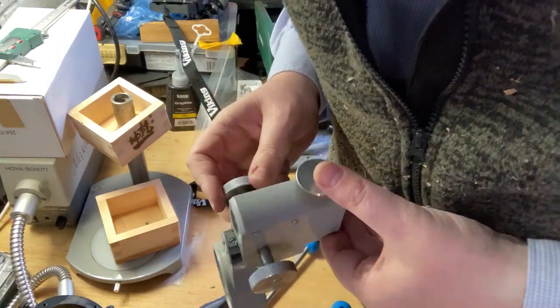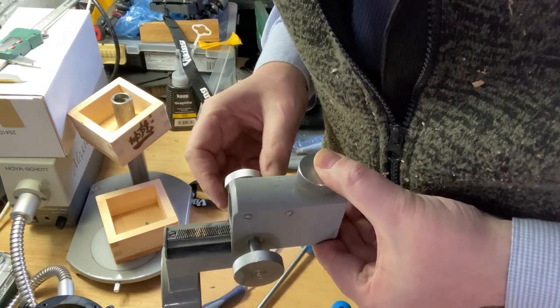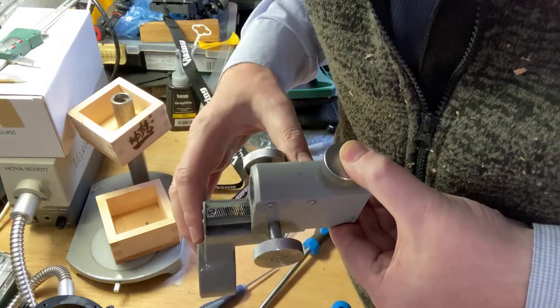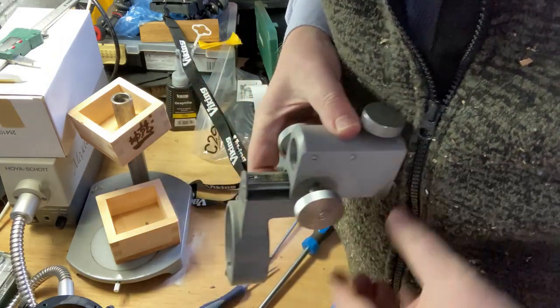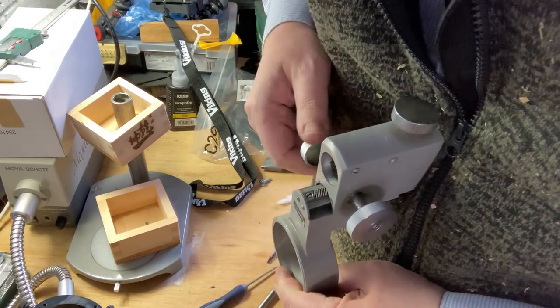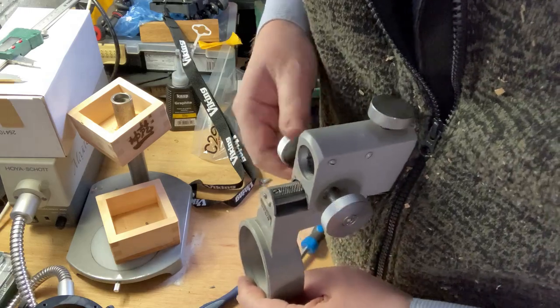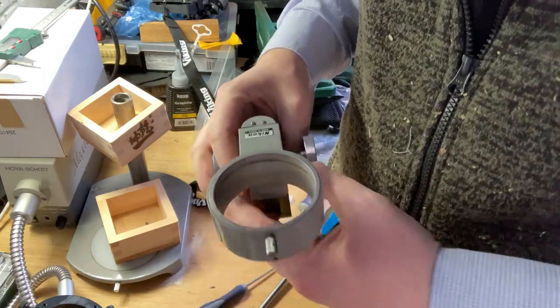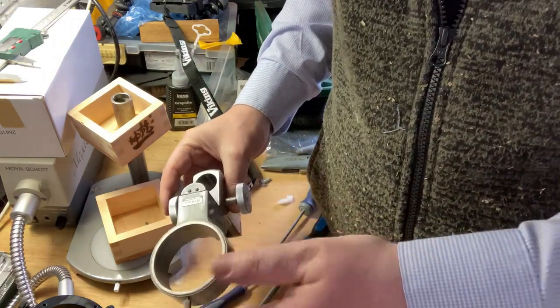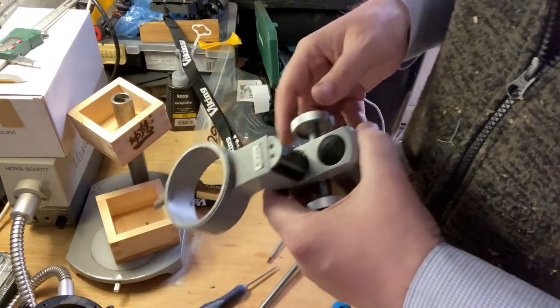As you see, when it comes out, see how I was able to get past this bit because there's no weight on it. If I was to put weight on this side, it might skip a bit. Well, of course it works this side, but when I was going up and down in the microscope, it was catching at that bit, and that's why I'm wanting to replace it.